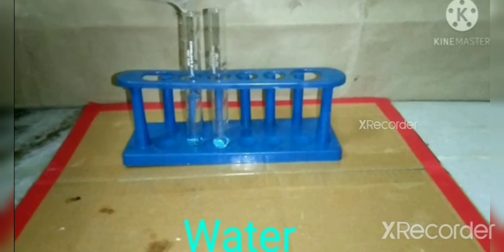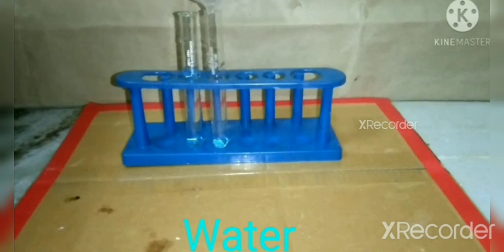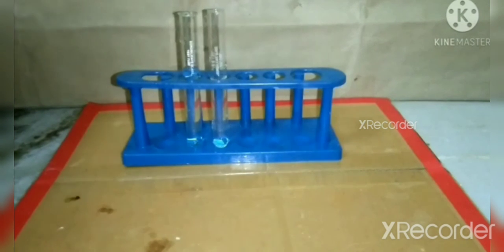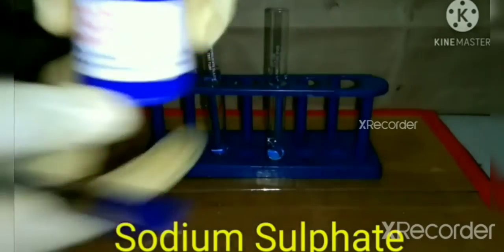Fourth part of the experiment, that is the reaction between sodium sulfate and barium chloride solution. Here we are taking a test tube stand and two test tubes. Then in them we have poured water. Now we will take sodium sulfate and put it in one test tube and make the solution.